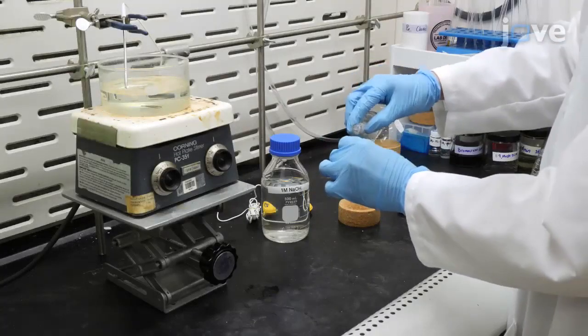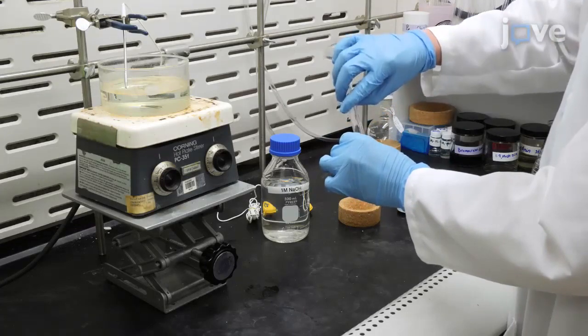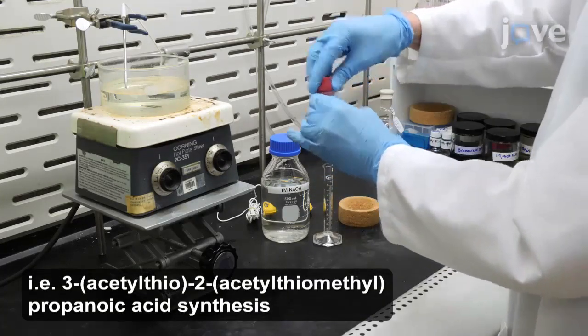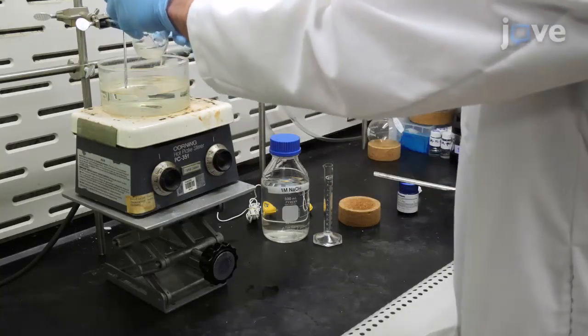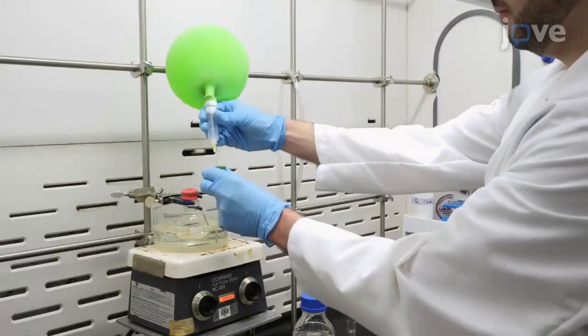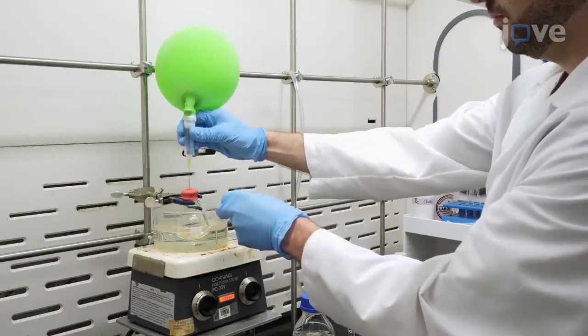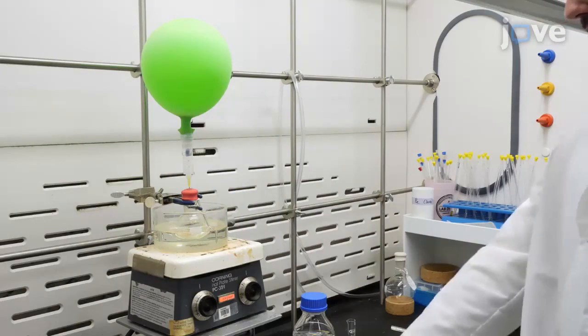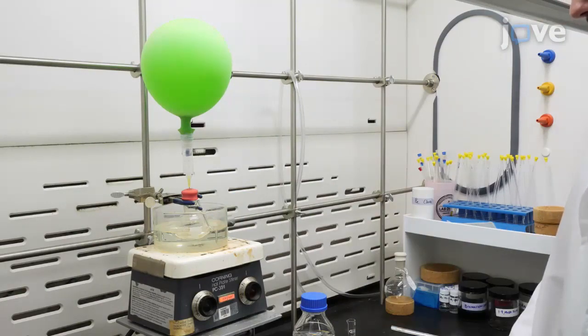To synthesize the dithiolane precursor, first dissolve 1 gram of 3-bromo-2-bromomethylpropionic acid in approximately 4 milliliters of 1 molar sodium hydroxide in a 50 milliliter round-bottom reaction flask at 55 degrees Celsius with stirring. When all of the reagent has been suspended in solution, seal the reaction flask with a septa and place the flask under nitrogen atmosphere.